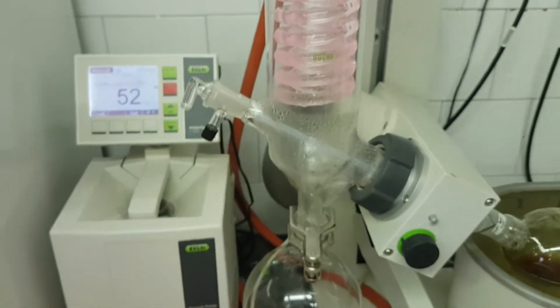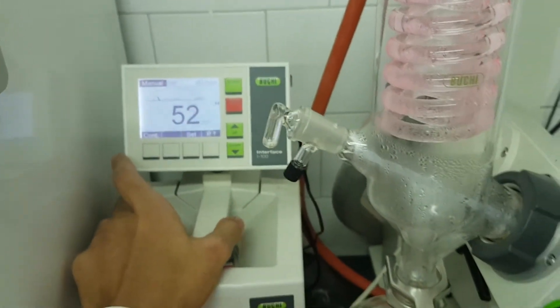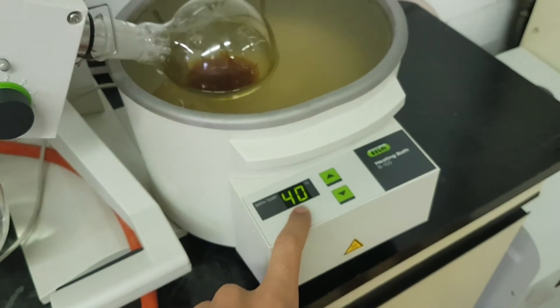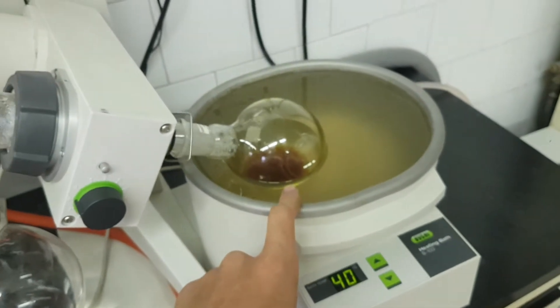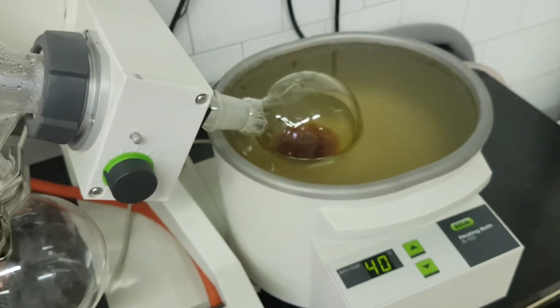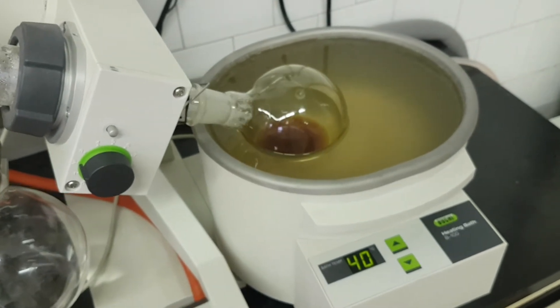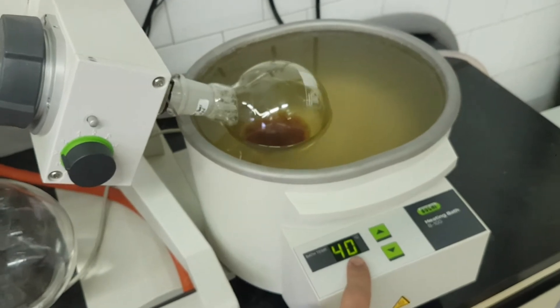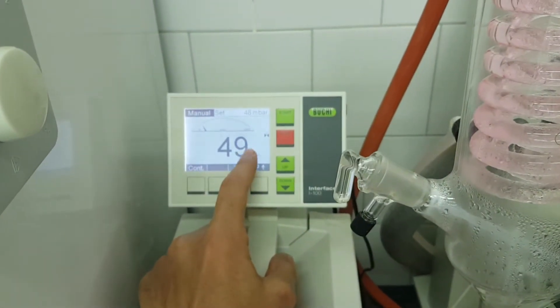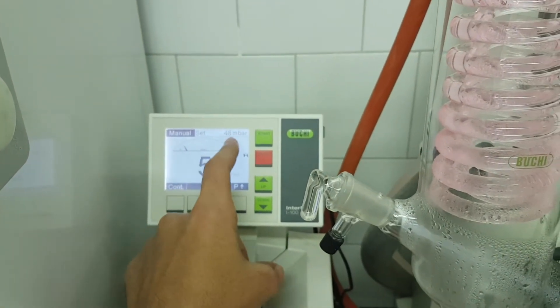As we know, the boiling point of water is 100 degrees. But if we use 100 degrees here, we will denature our mixture — we will not have stable molecules. For this reason, we use only 40 degrees, and we decrease the pressure. The standard pressure of water is 70 millibar, and you can decrease more.